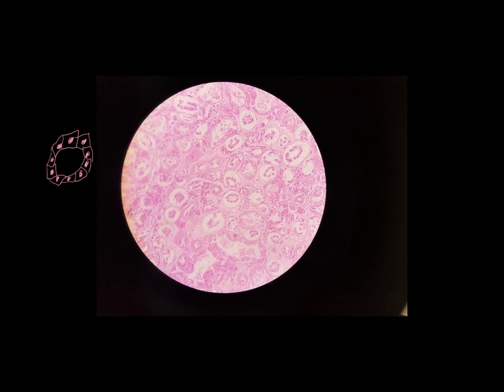But a lot of students come up with the question of, how is this a single layer thick? Well, let's look at this ring right here. We can see inside there doesn't appear to be anything there, and that's the case. This is hollow. And then around the outside, there's nothing there. This part is kind of not completely hollow, but kind of hollow. So there's nothing on this side, there's nothing on this side. This is a single layer thick. It just happens to be rolled into a ring. So one layer thick, and the cells are roughly cube-shaped.